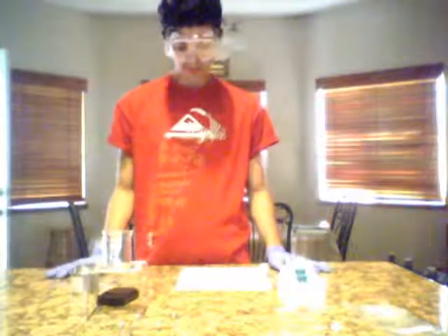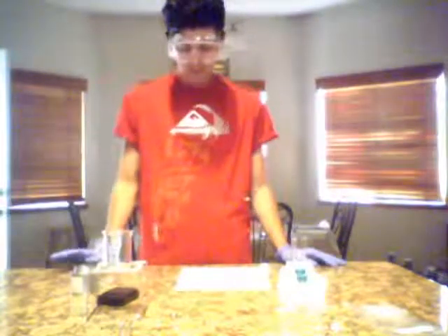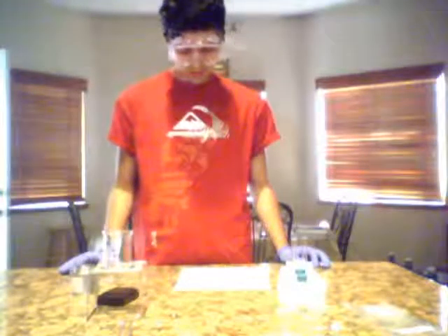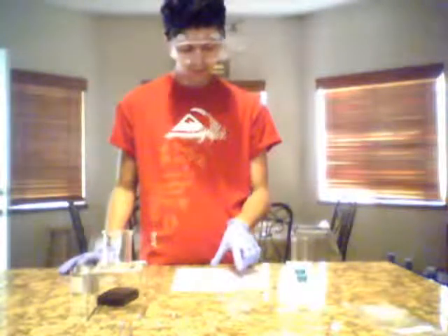Okay, today we are going to be doing experiment synthesis of fragrant esters part 1. First one is to wear your goggles and your gloves. Mark 3 test tubes with the numbers 1, 2, and 3. Record which numbers will relate to the esters as reflected in the data table. So I've gone ahead and labeled all of my test tubes accordingly, and they are right here.